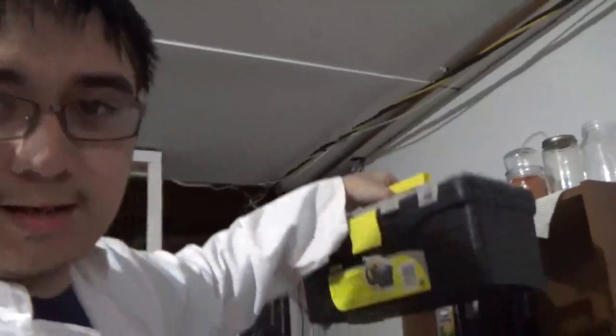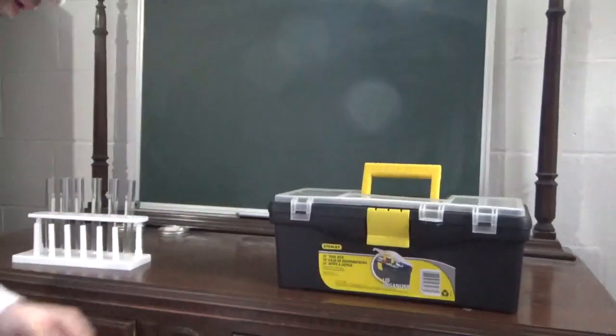So that's the first thing we're going to need. We're also going to need some test tubes because, I mean, you really can't have a chemistry tutorial without test tubes, am I right? Now this box contains a lot of the chemicals that I own.